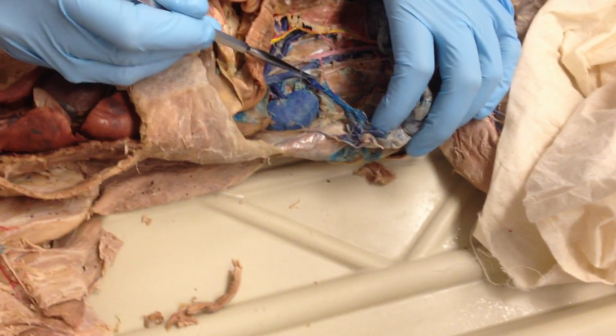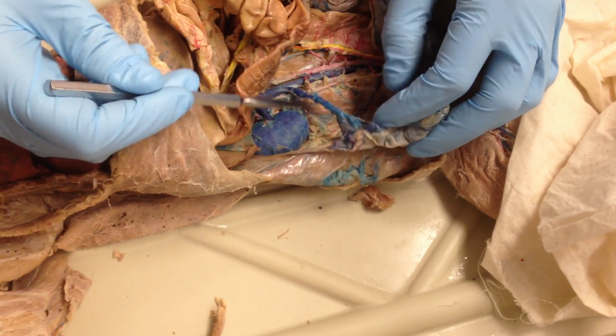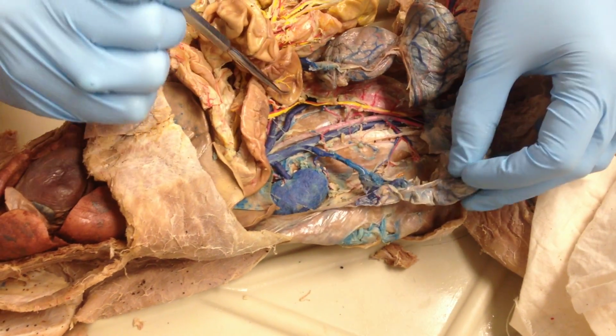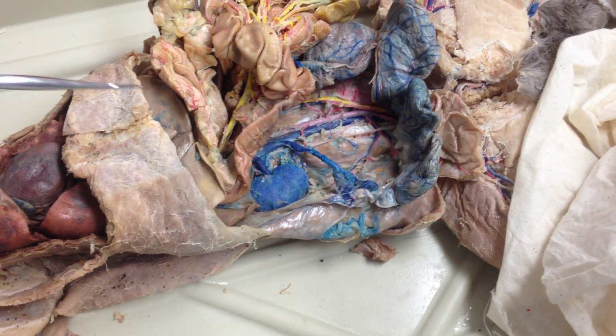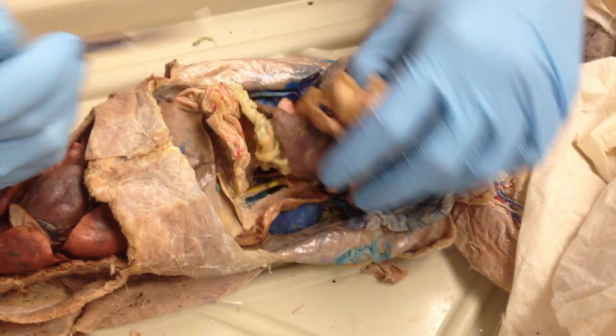This is a better intact ovarian artery and vein on this side, which was genital, generally, or testicular in a male. Do we have to specify, not just gonadal? If I say what is this, genital or gonadal is fine. If I say be specific, I want ovarian or testicular.